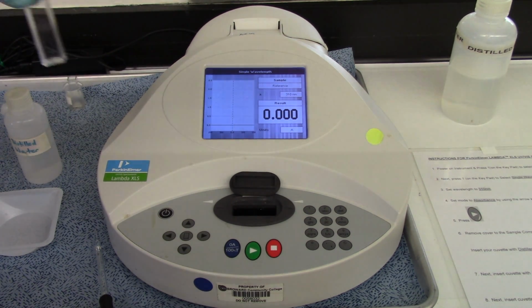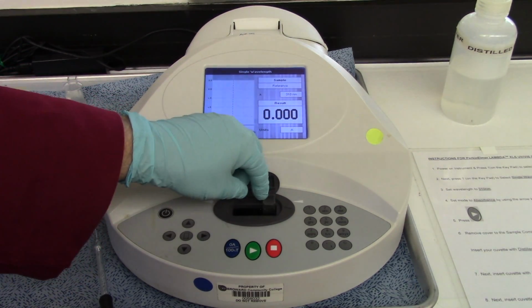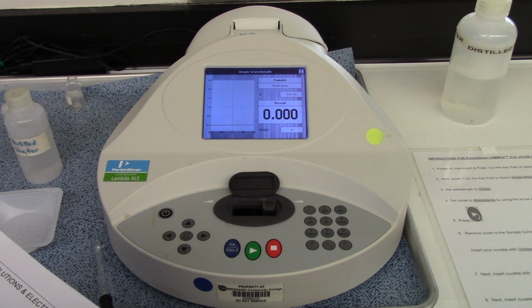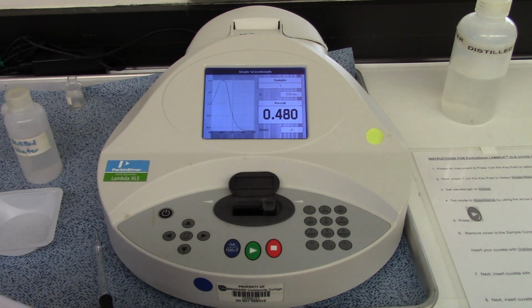Now here is a cuvette that I've already loaded with the standard. The standard vitamin C solution is already in here. So this is the gold standard, if you will. And you're going to write this number down in your book, under absorbance of standard, right above percent error. Absorbance of standard. So here we go. And there's my absorbance of standard. So write down, by absorbance of standard, 0.480. And if you want to put a unit, put the unit A for absorbance. That is the absorbance of the vitamin C in the standard concentration.